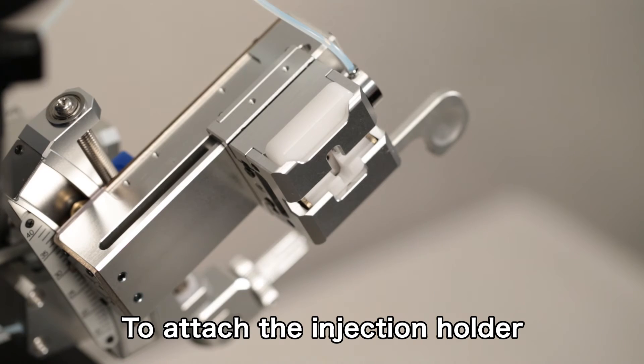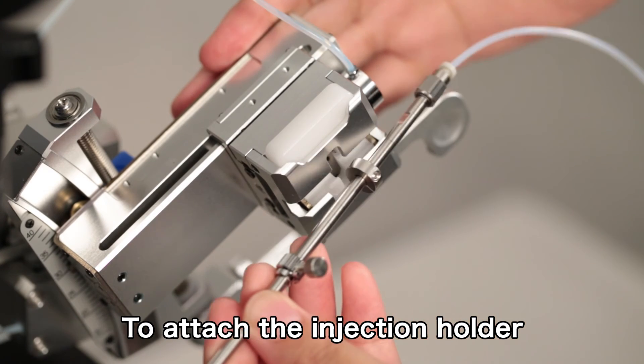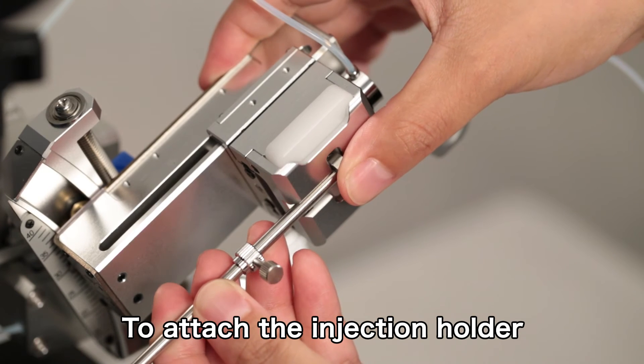To attach the injection holder, click in the anchor in the socket with the thumb while holding the back of the slider securely.